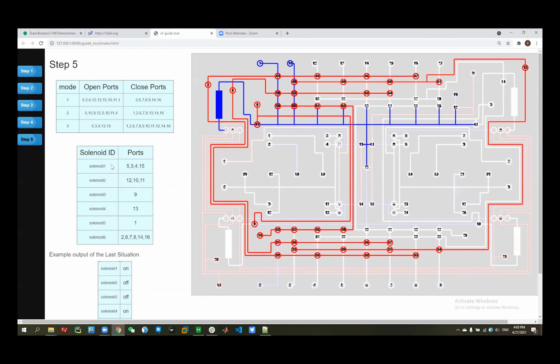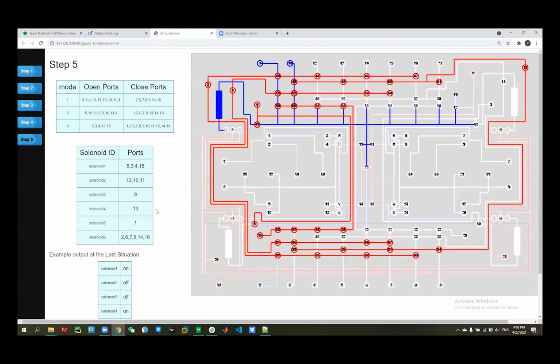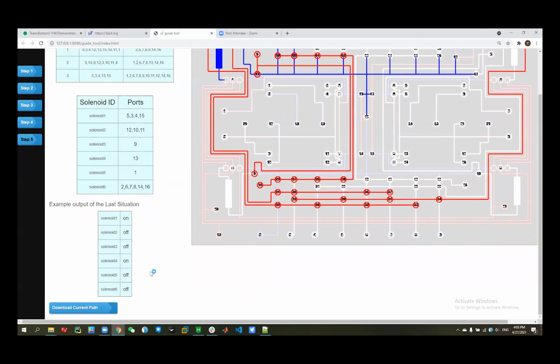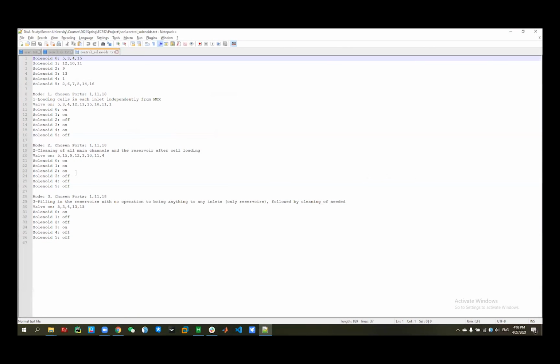So each port in the solenoid will have the same states in different modes with other ports in that. So then it will help us to save more solenoids time and energy while we operate it. And it will form a text file, and we can download it. And we can see what it looks like, and it gives you how to control it by on and off, and some functions or some packages in MATLAB can detect this and help us control the device automatically.